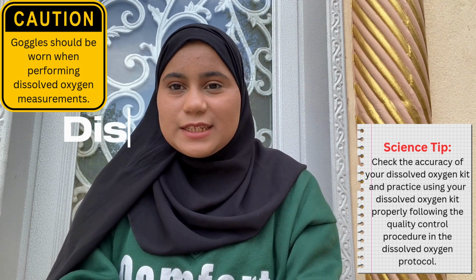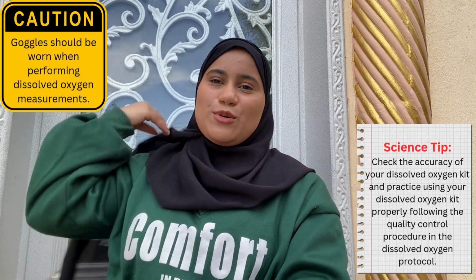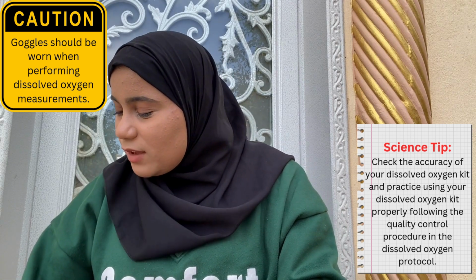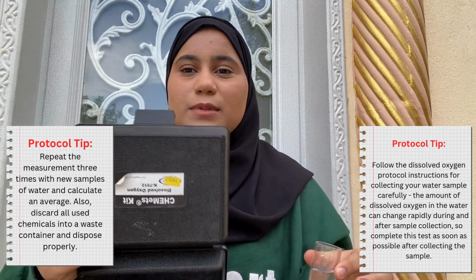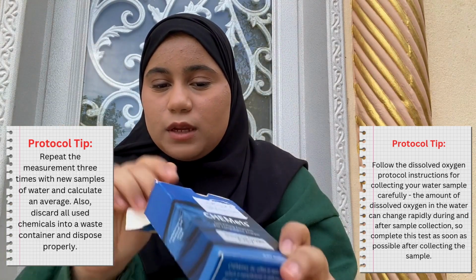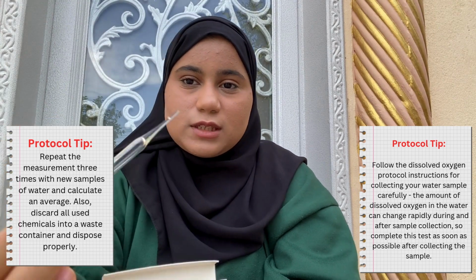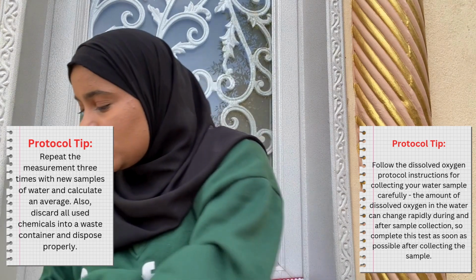Okay, now we're going to get to the magical part. We are going to get to the dissolved oxygen. This is so fun to do. It's kind of magical as well. I've got this little kit with me that we are going to use today. It's going to help us get the dissolved oxygen in the water. You get this box, and when you open it, you can find little samples of these right here, which is this tiny thing with liquid in it.